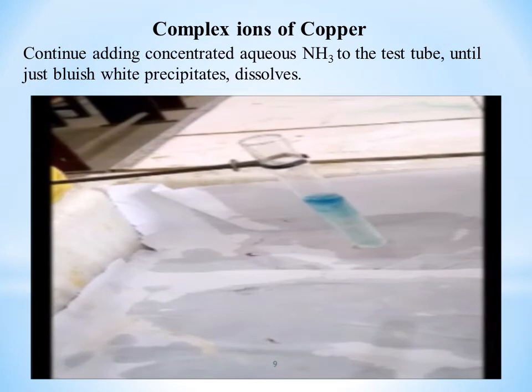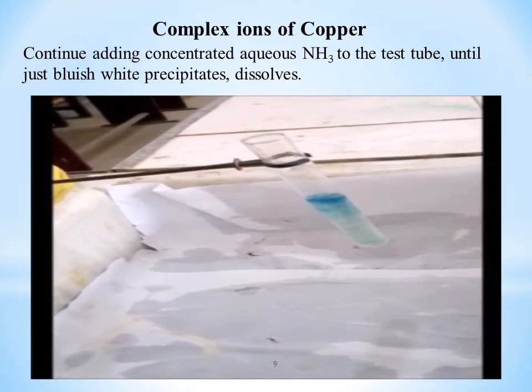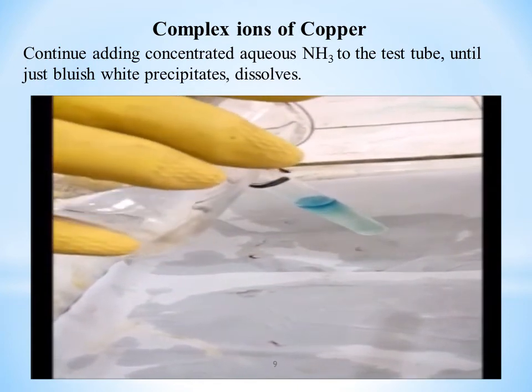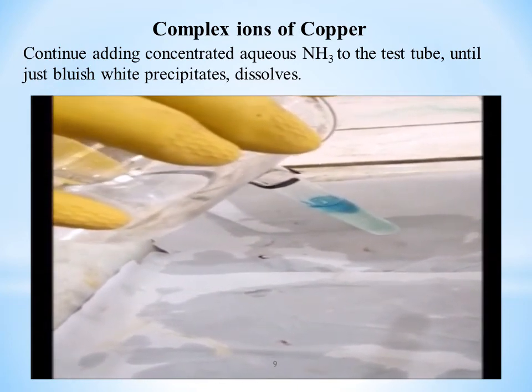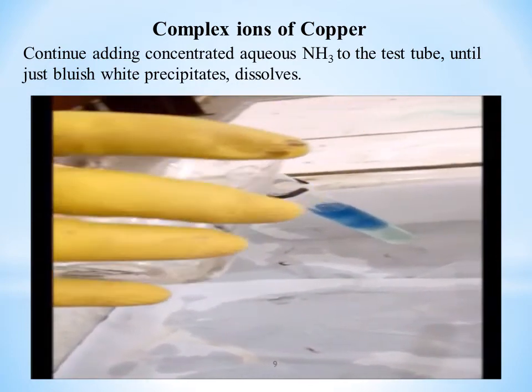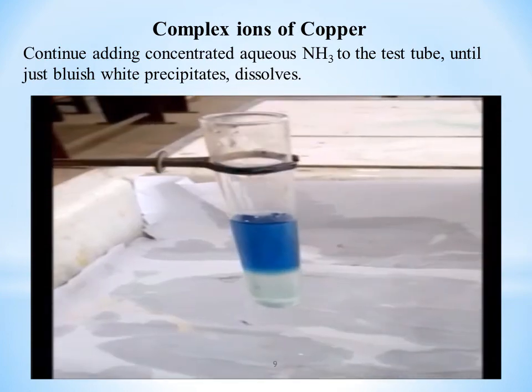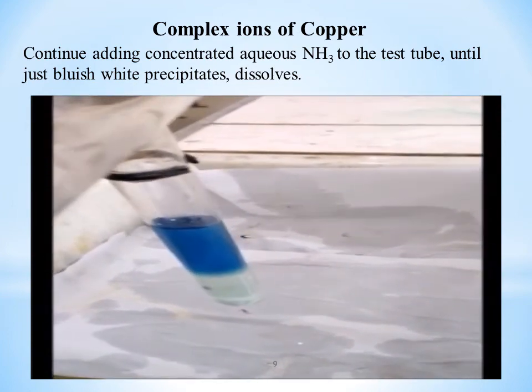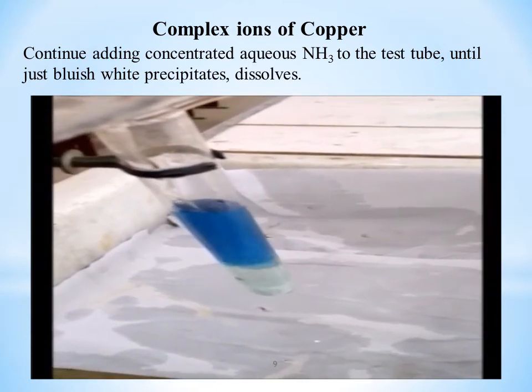When excess of ammonia was added, the bluish white precipitate that appeared will be dissolved. What product is forming that is responsible for this royal blue coloration, or responsible for the dissolution of bluish white precipitate, you will see in the next slide. With the help of chemical equation you can understand it easily.